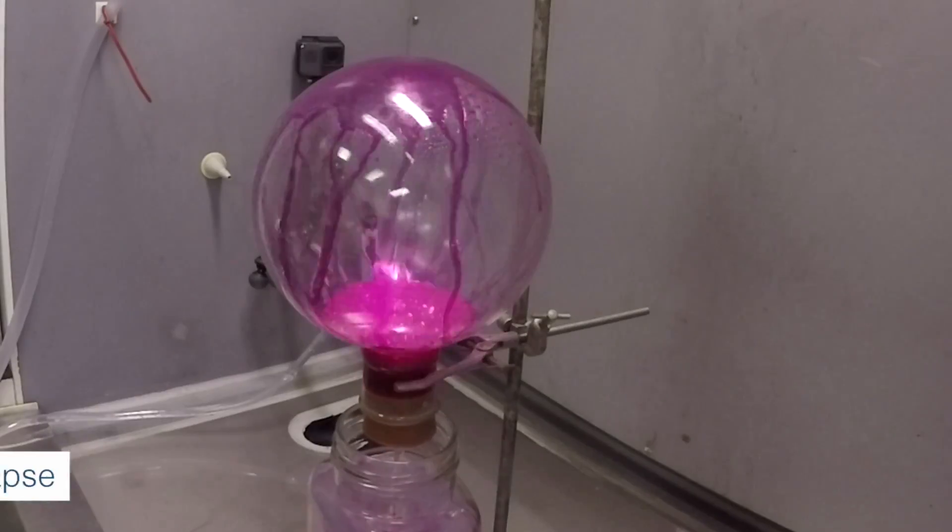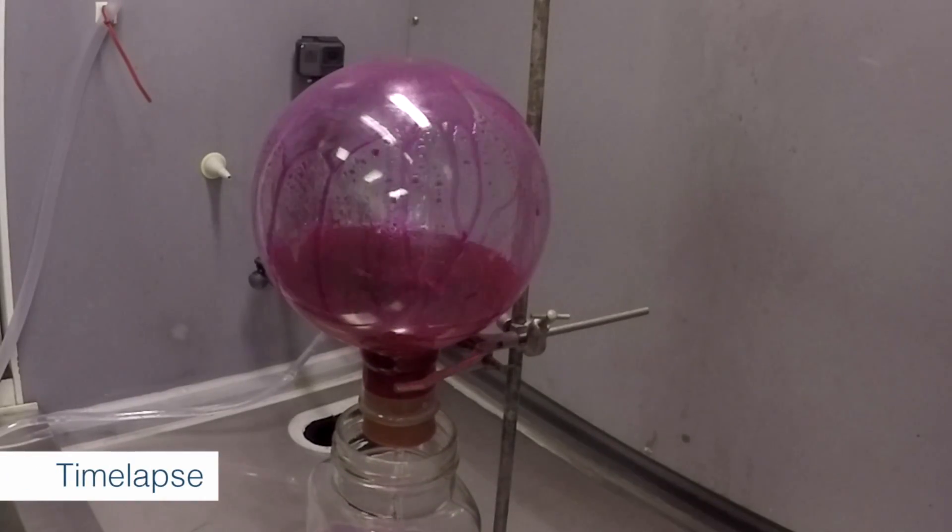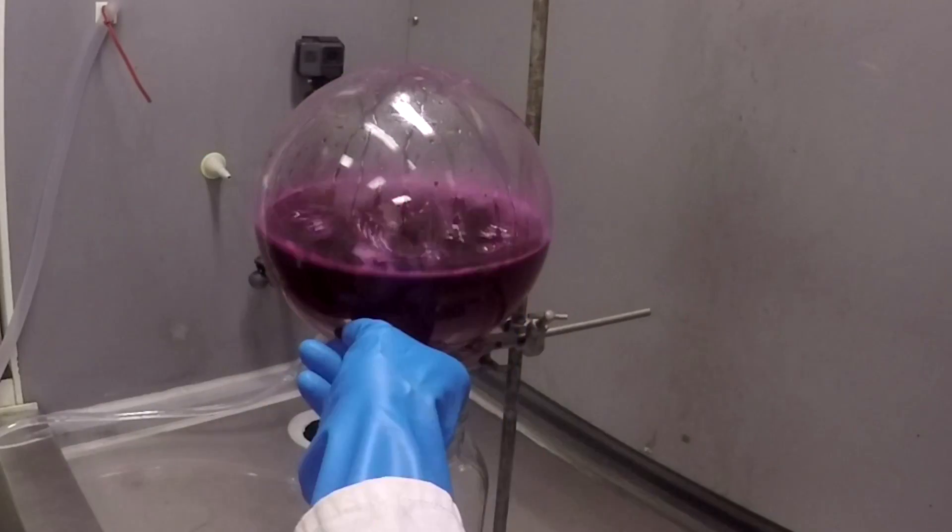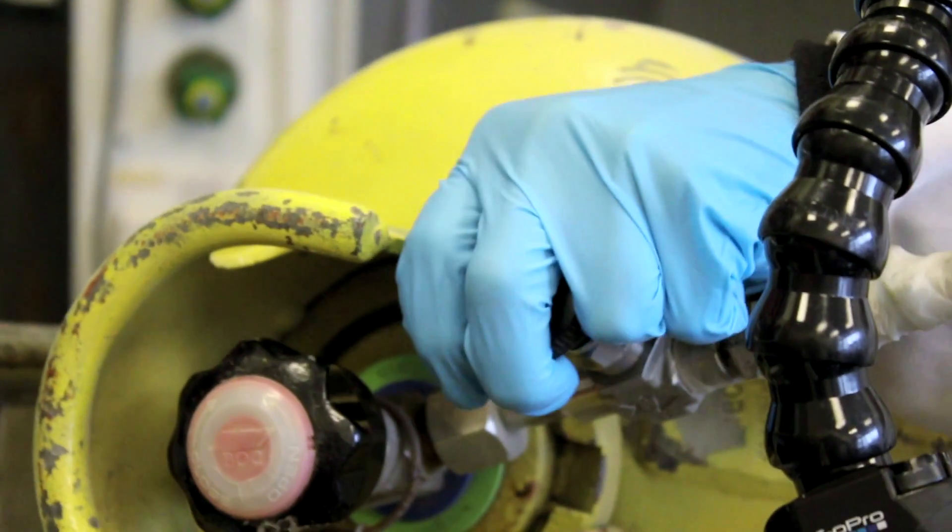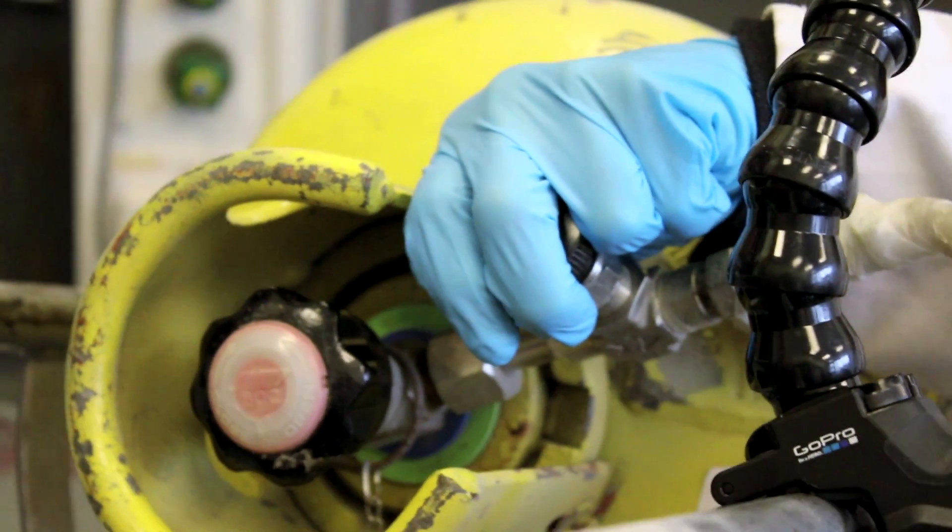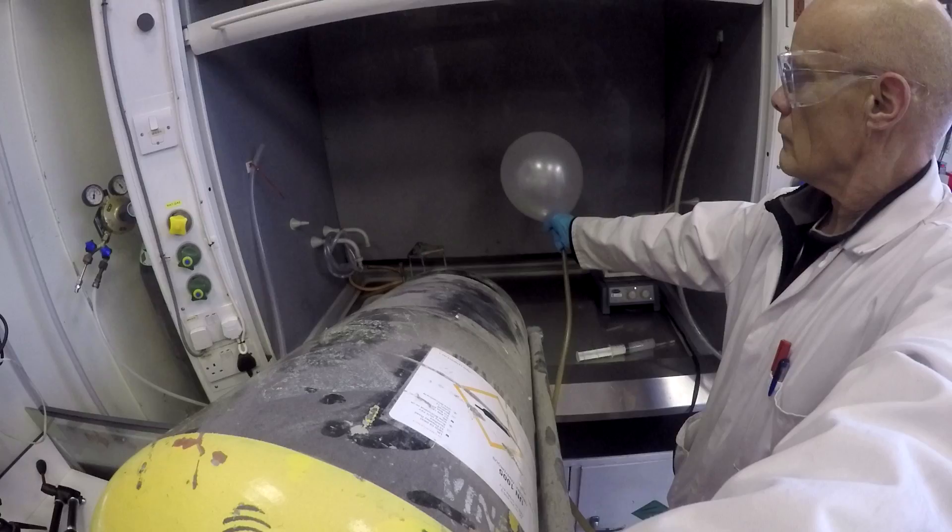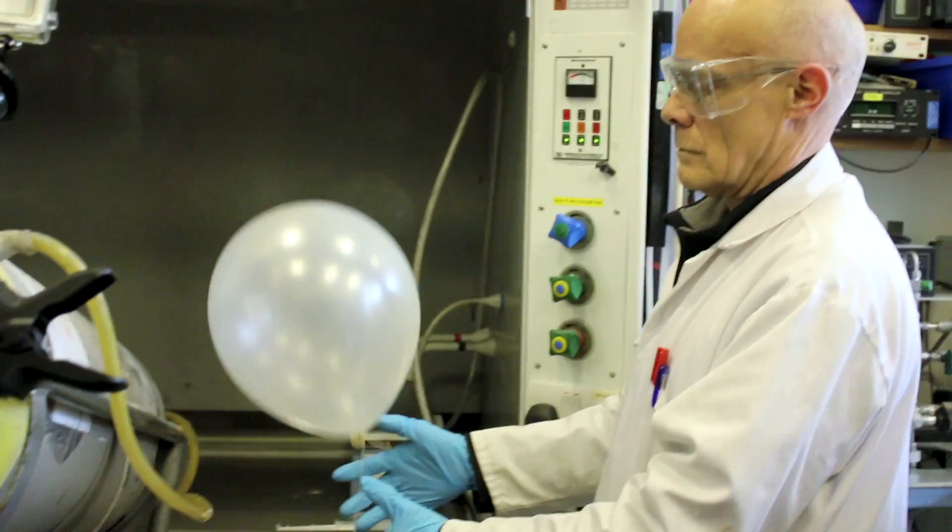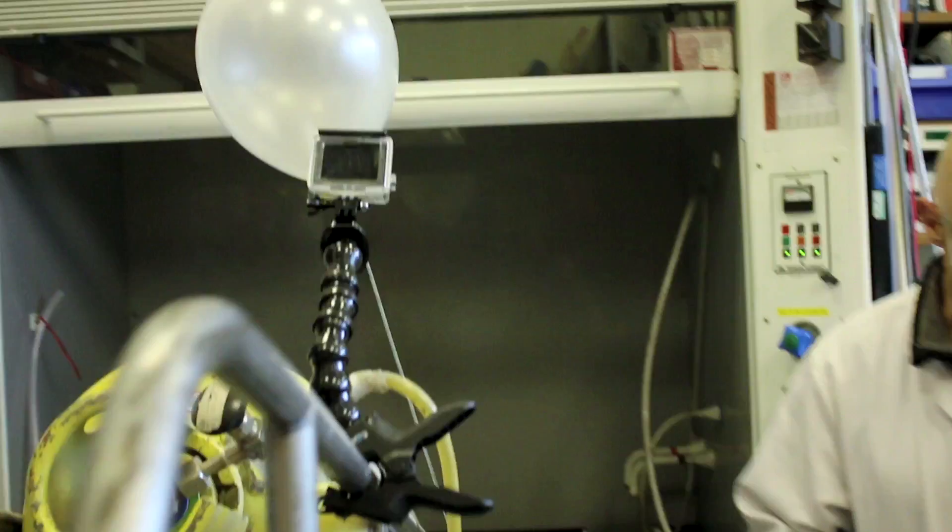The next demonstration, or really it's an experiment because we didn't know whether it would work, began with my idea that we should try filling a balloon with ammonia. Because ammonia is lighter than air, I just wondered whether a balloon of ammonia would float. Not something you'd want to use at a party because if it bursts there'd be a smell, but it does float quite nicely.